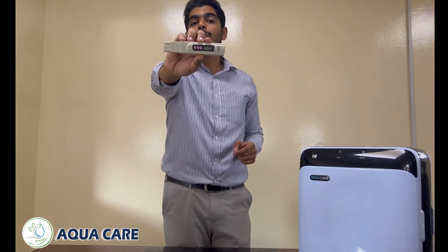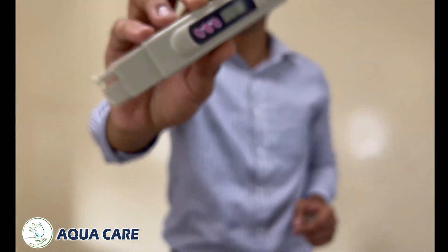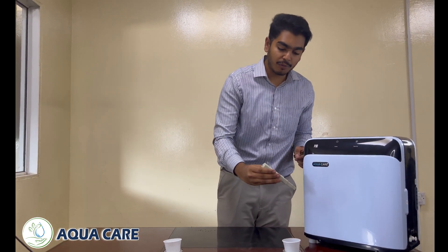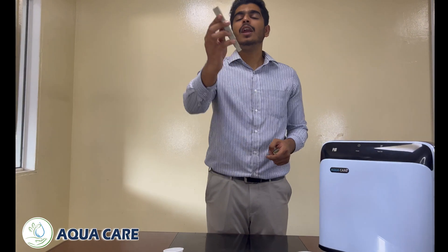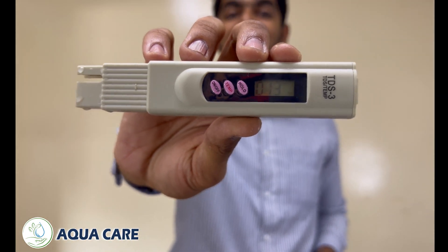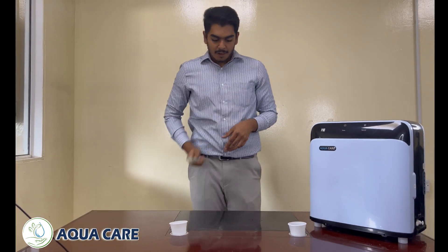As you can see here, the TDS of tap water is 228. Now I am going to show you the TDS level of RO water. Here you can see the TDS level of RO water is 13.